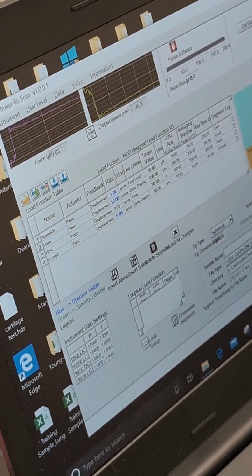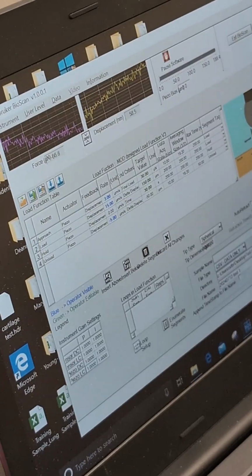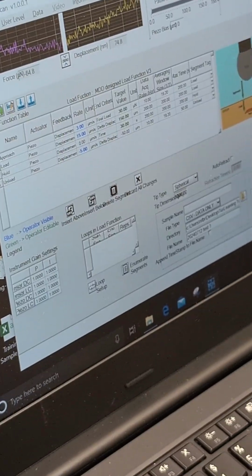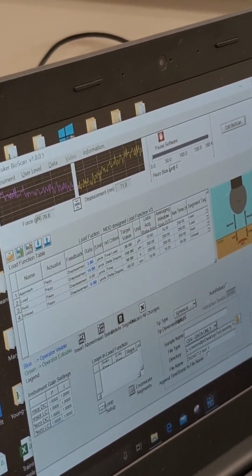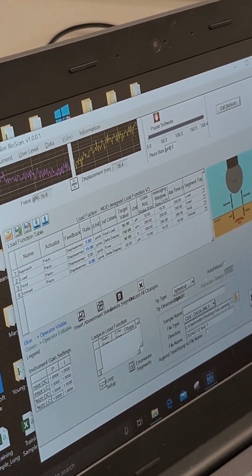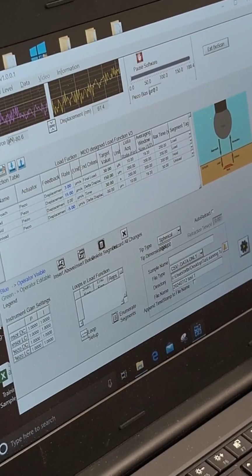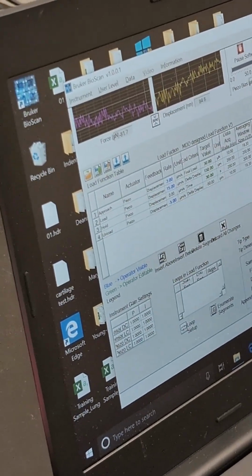Again, the format of your sample, because your hydrogel is too tiny, you don't really have that much wiggle room. Next time, if you go with a 96 well plate, this process is much easier to achieve. You have a larger surface that can capture your probe, so it's much easier to adjust to the final value of -100. Again, you kind of have to play with this force to know where to start, but it's always a good idea to hold the starting force as a constant so that you can compare between different hydrogels.